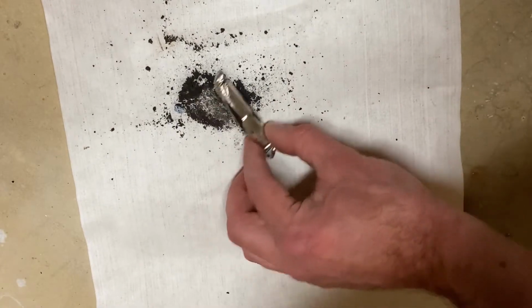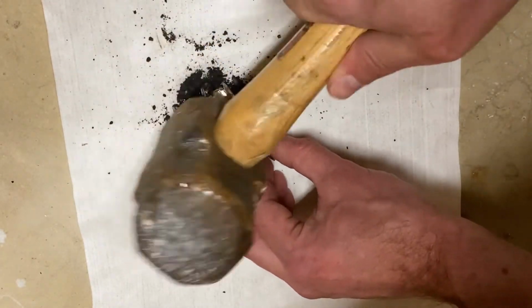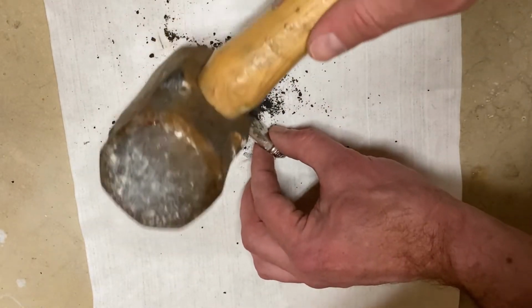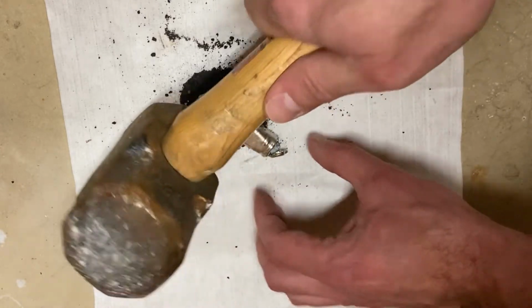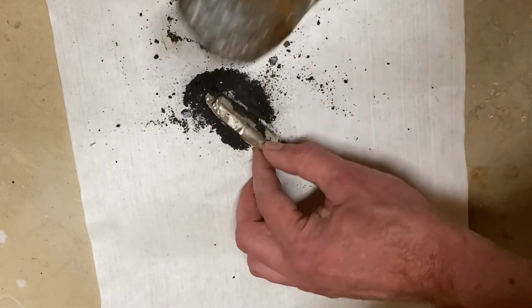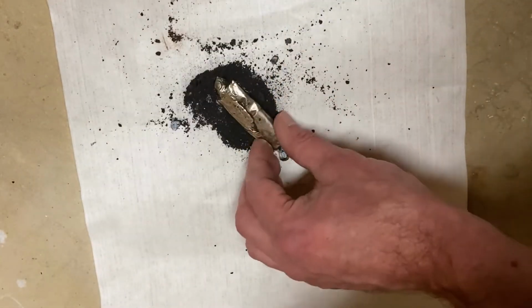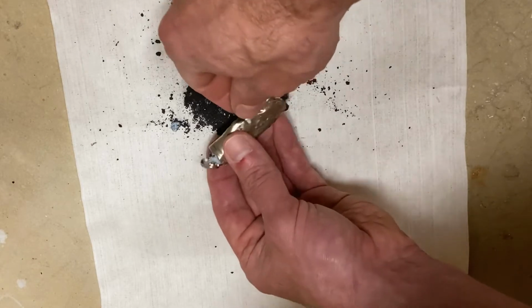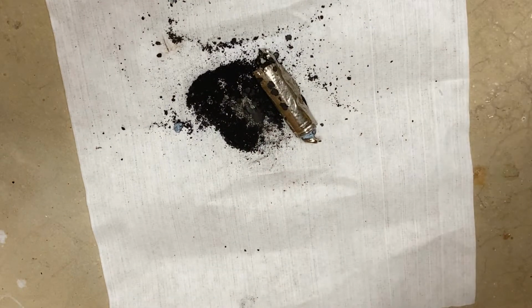If I wanted to be a little more careful about this, there would be some ways that I could do that wouldn't require those separations as much, because the zinc oxide is already physically separated from the manganese dioxide by a piece of paper. But I was thinking that this was going to be a big hassle if I had to use, say, a Dremel tool or something to open this, which was looking like the other viable option. Say the jury's out on whether this is the better approach or the Dremel tool would have been better. But I think it's pretty much ready to give up the ghost here. I might need to use a screwdriver or something to help that along.